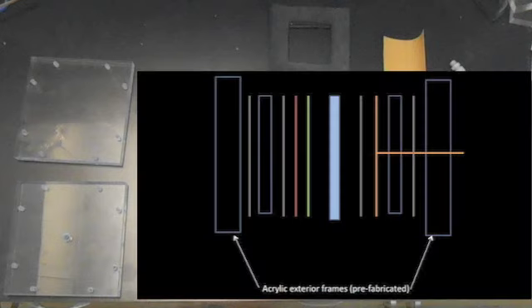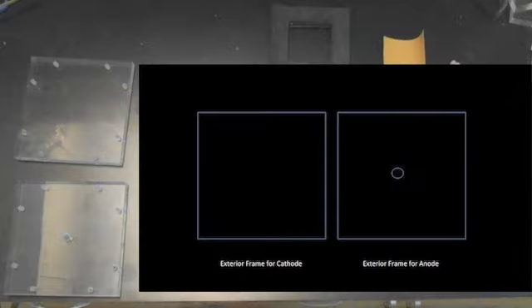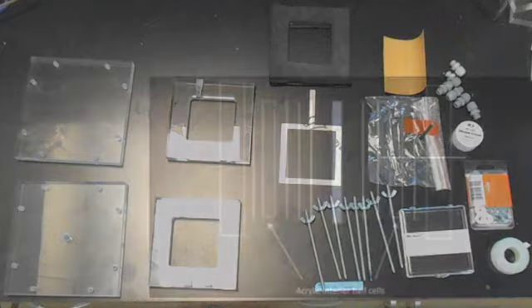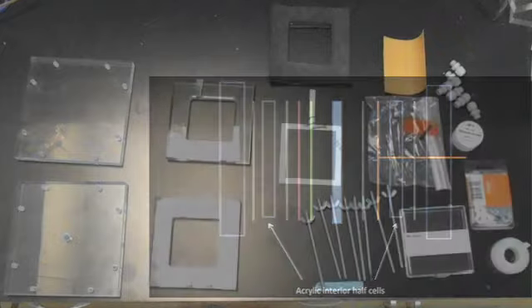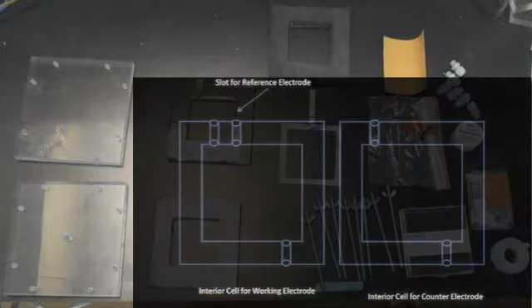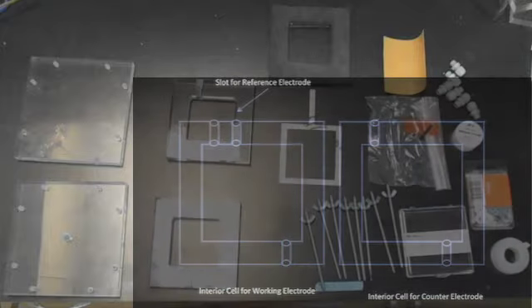Firstly, we have our two acrylic exterior frames with holes on the perimeter for the threaded rods. One of the frames has a hole in the middle to accommodate our anode. Next, we have two acrylic interior half cells which we cut and tapped holes to house the tubing and nylon glands. The working half cell has an extra hole to accommodate the reference electrode.